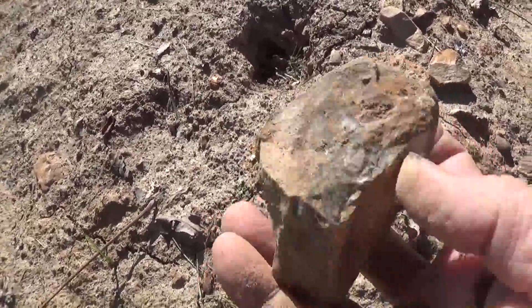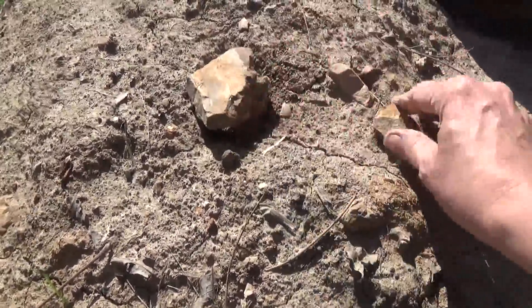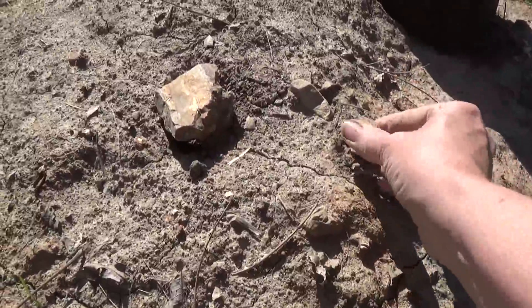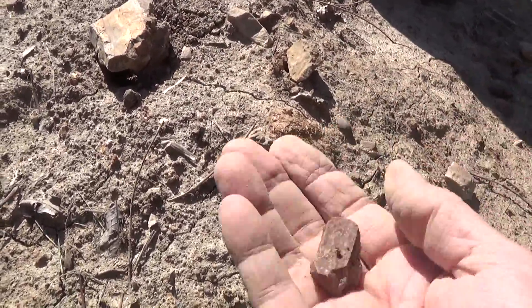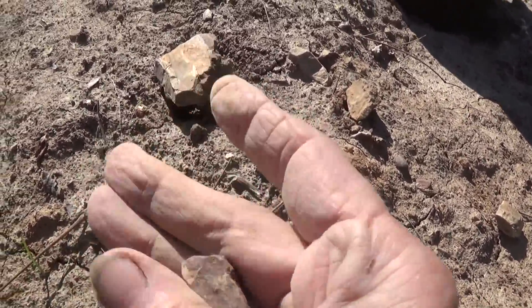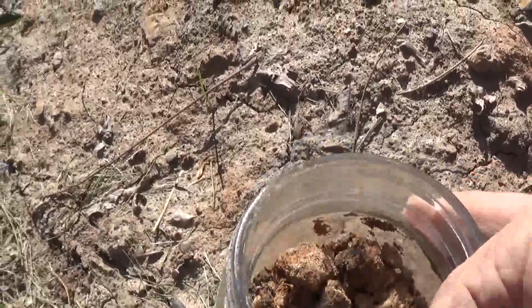It picks up some of the rocks — here's one of the rocks. It's multicolored and a little sparkly, mostly white with a little bit of red. Possibly clay or I'm not sure what mineral. And this is a really red rock — it sparkles, which might be sand.